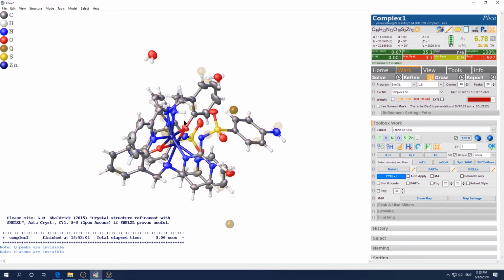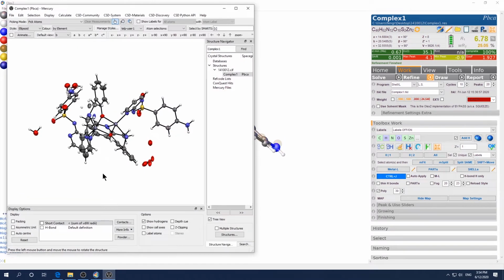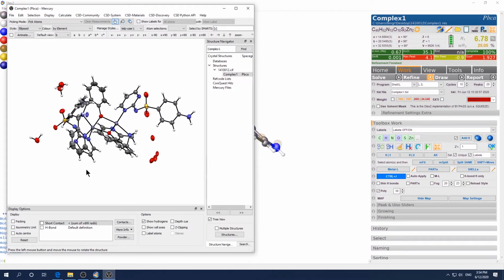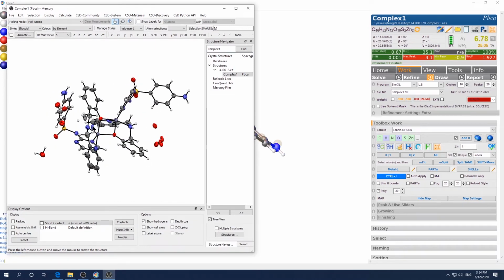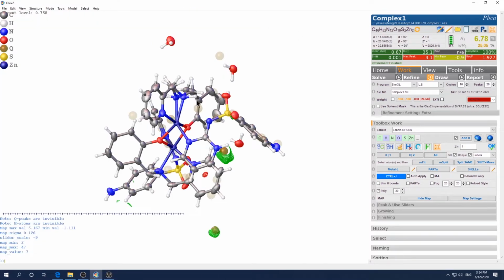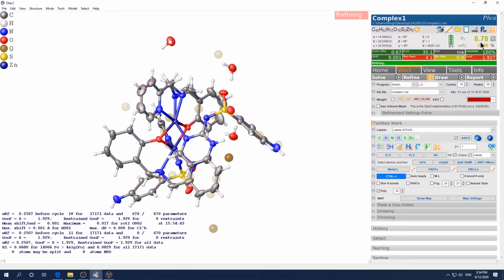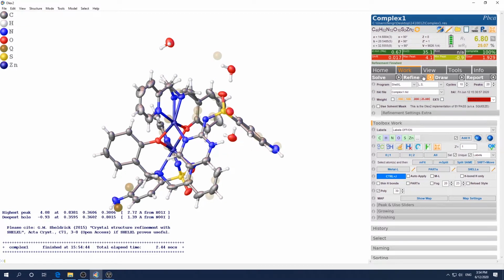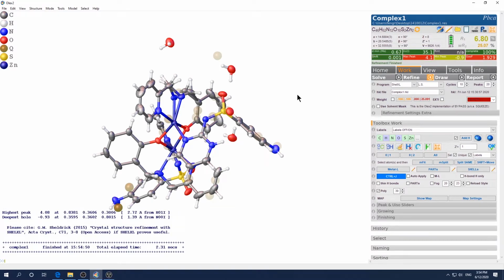Oh, okay. See, that nitrogen should not have a proton there, of course, right? So basically, I want to see if that. Okay, so this nitrogen does not have a hydrogen, so we want to remove that hydrogen here and here. Here and here. This probably will not affect the R value because it's very light. Yeah, it actually goes up a little bit. It doesn't matter because based on chemistry knowledge, you should not have hydrogen there.